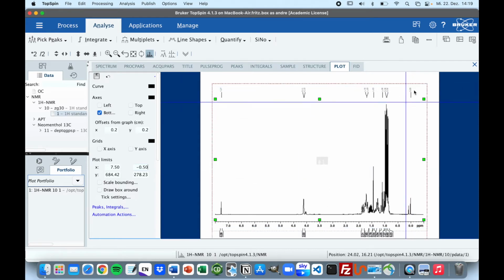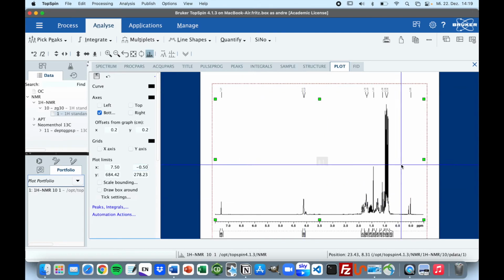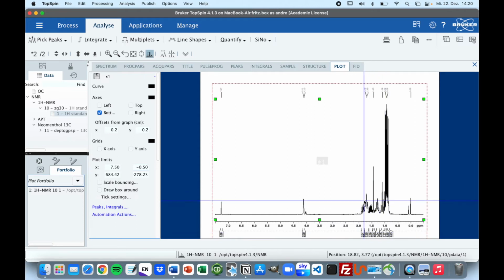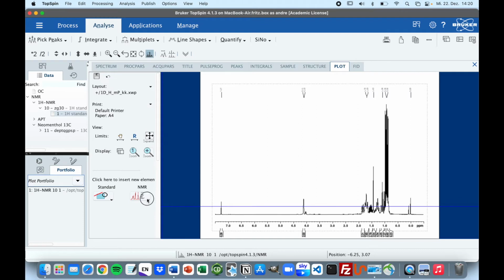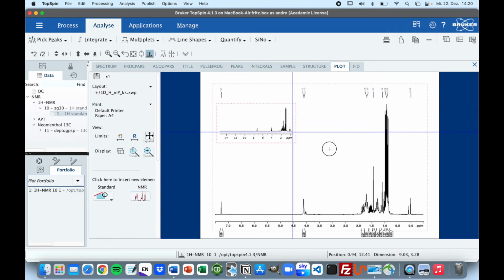So as you can see now it's visible, and this spectra looks decent, but we have a lot of peaks and integrals even, which kind of collapse in this small area. So the next step is to make an inlet so we can zoom in into this area. For this we are going to click on this blue space here, we go to NMR, and we will select in 1D spectrum, and you can drag it here.